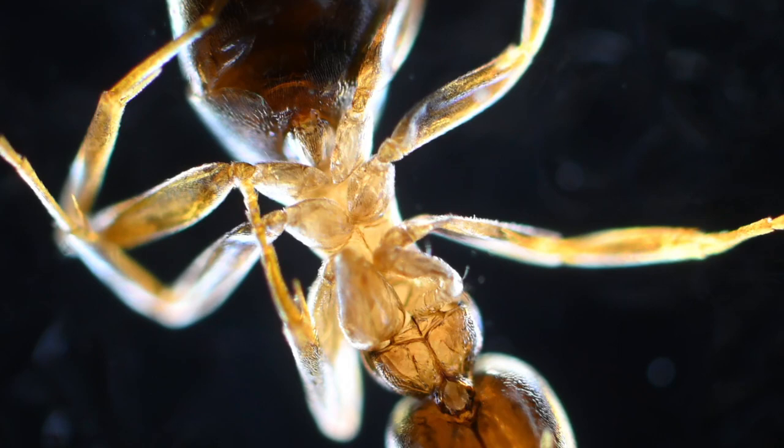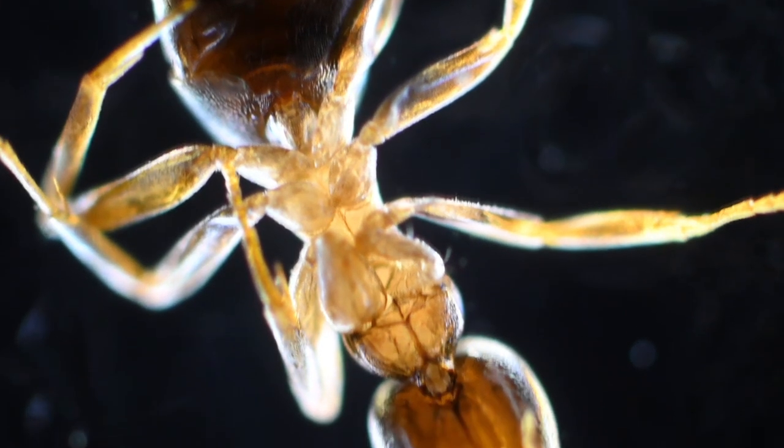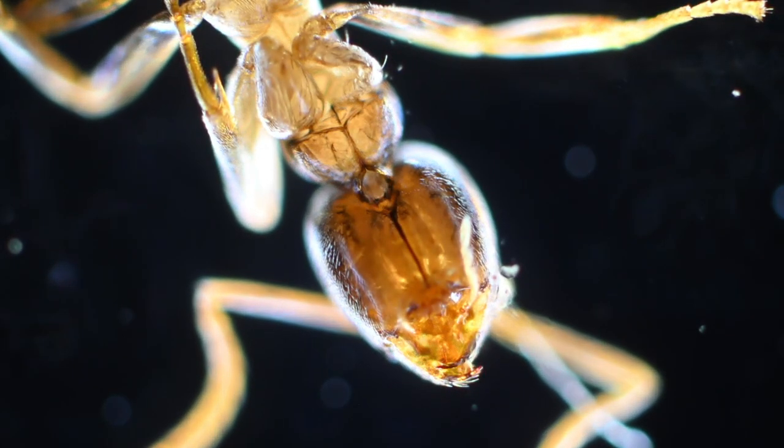And here we are looking at an ant from underneath. The amount of detail is, again, amazing. I think every human being should look through a microscope and a telescope with their own eyes in their lifetime. It really puts us in our place, gives significance to the really, really large and the really, really small, and all the life that can be in a single drop of water. I think this is an experience kids can really benefit from and appreciate how complex life actually is and how fragile it is at so many levels.